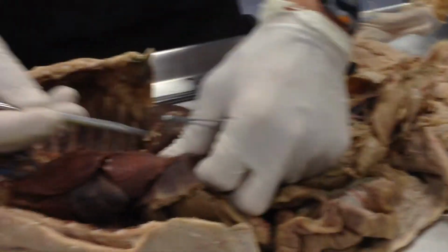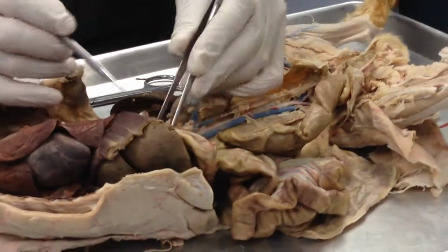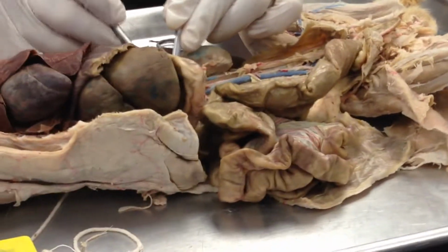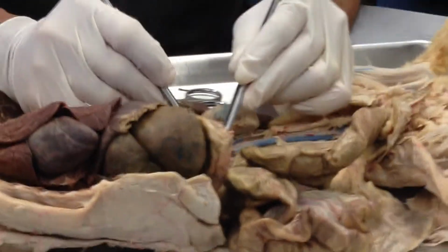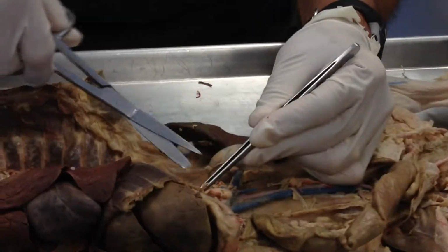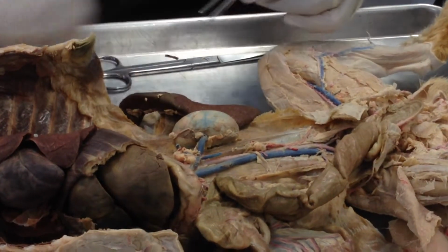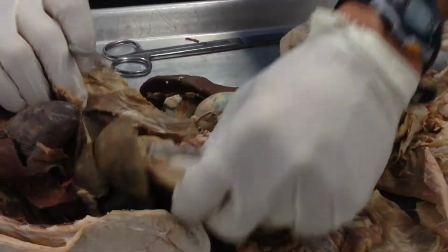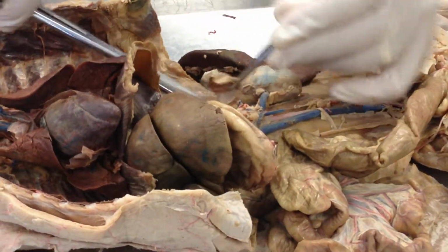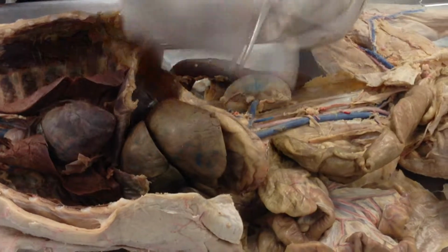Then, as we said, there's nothing else in the thoracic cavity other than the aorta, just running down right there. But when the aorta crosses the diaphragm, then I look for two arteries. So the diaphragm is a point of reference for us to keep an eye on. Once we pass the diaphragm, we see the two arteries. The first one is the celiac artery.